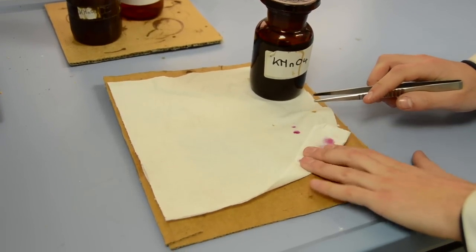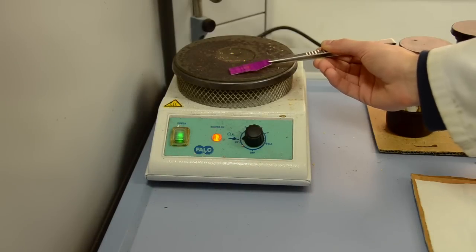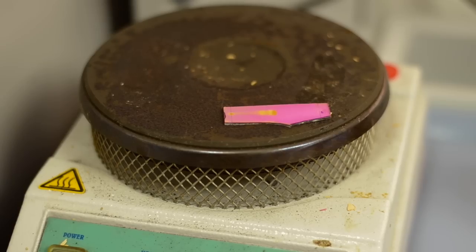Dry the purple stained plate with a tissue and heat gently for a brief amount of time until clear yellow spots start to emerge.